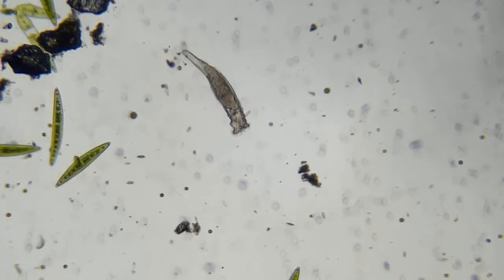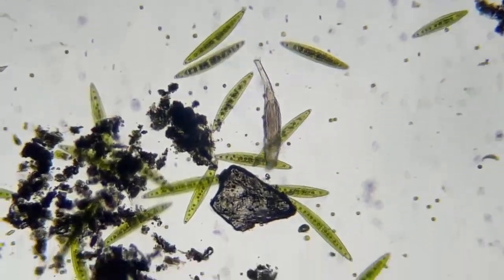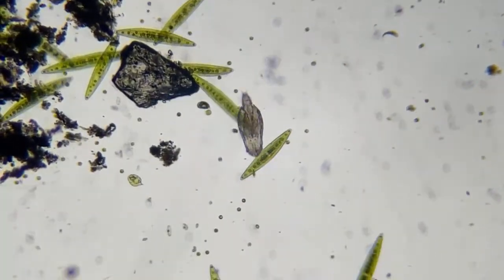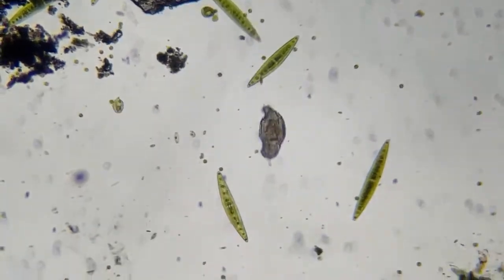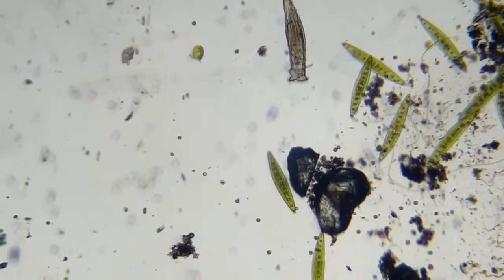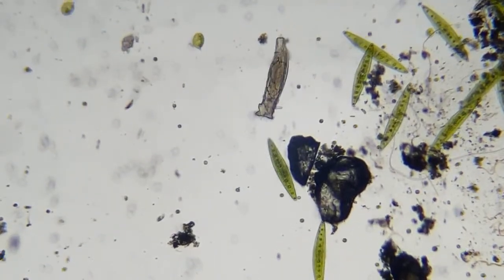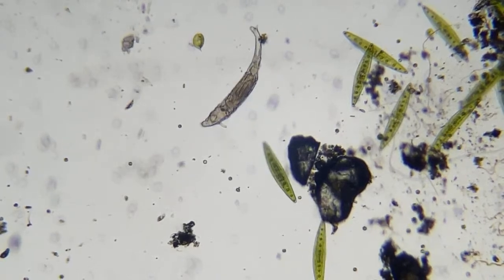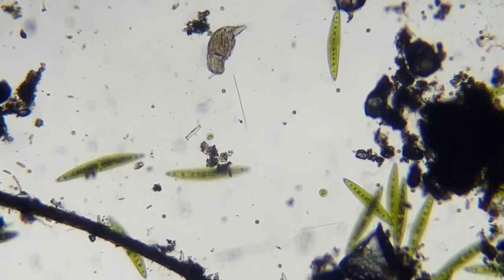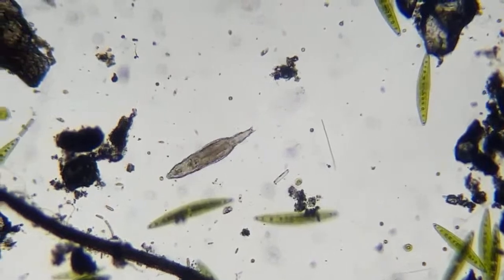So this is a good test for YouTube. I'm gonna go back and look at it and see how it looks when I'm finished, because if I had to guess, it looks like it has a little better sharpness to it than Reddit allows. I'm not sure what those little circle ones are, but they're probably some kind of motile algae with flagella.